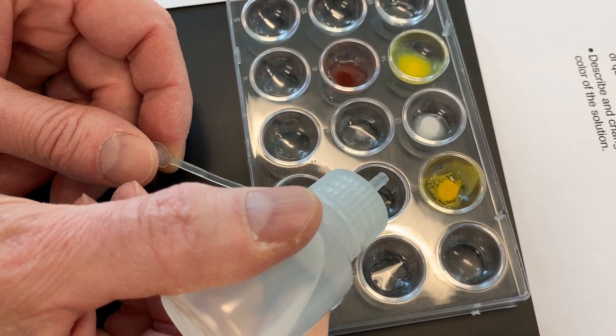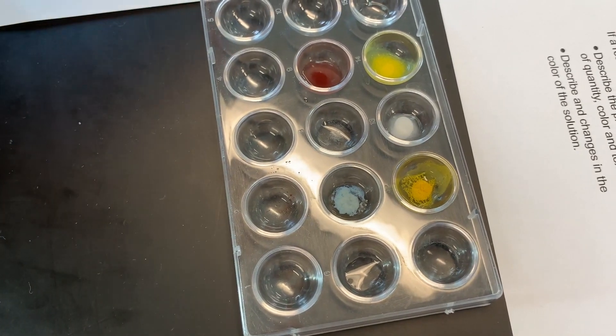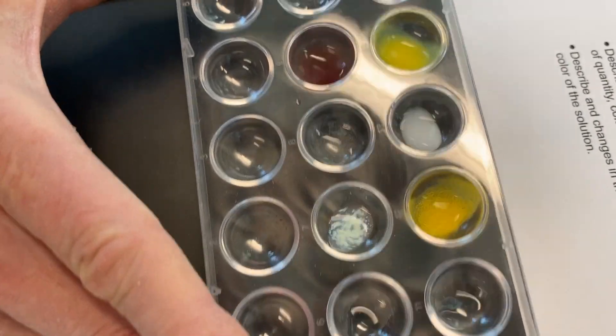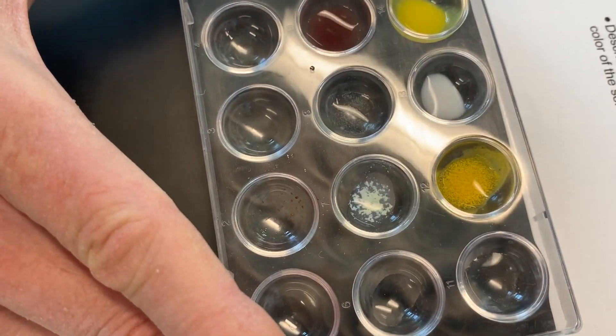Now a couple of drops of potassium iodide. Okay, that looks pretty obvious. Looks kind of like an off-white clumpy powder, almost a greenish tinge.